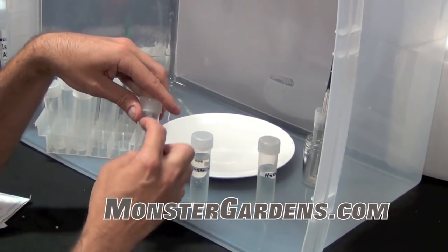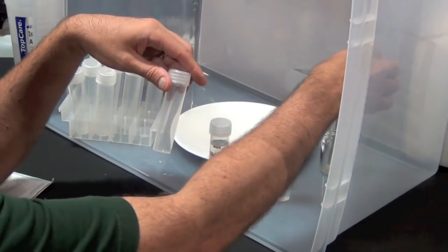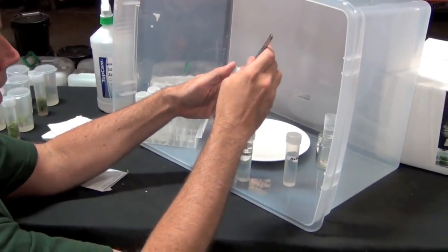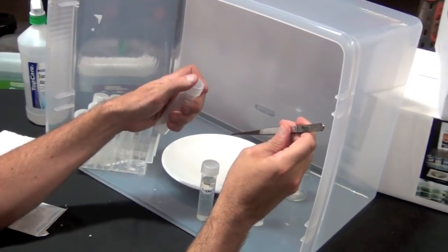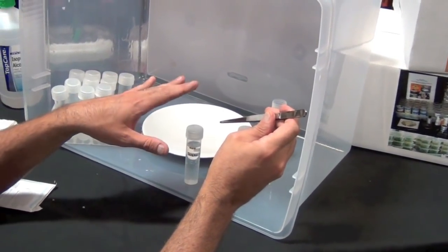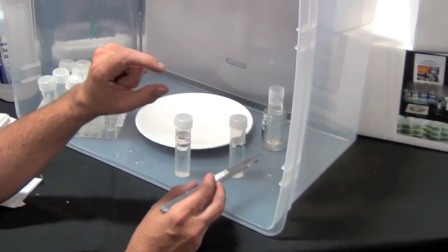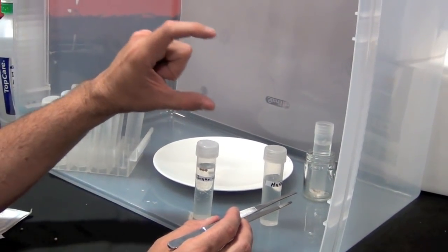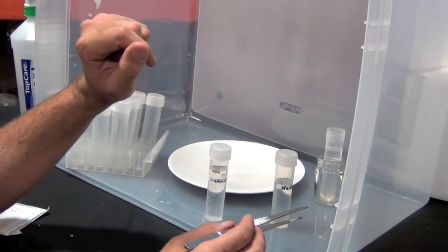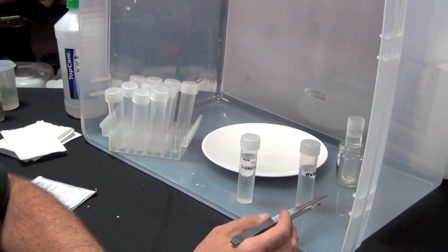We can extract the entire thing — roots, tops, and everything — and plant this into whatever we want: root plugs, small pots. We will have taken an old seed that may not have germinated and very likely would have become contaminated, and been able to grow it into a two-inch seedling that we can now plant into an ordinary pot of soil. When we're doing this with healthy, valuable seeds — some special tomatoes and vegetables where single seeds may be fifteen or twenty dollars — do you really want to risk just putting them in paper towels? Using these materials and this exact same technique, we've been able to soak, hydrate, and germinate healthy seedlings that grow tall in as little as twenty-four hours. Two or three days is still impressive. We're putting in mobile sugar and oxygen, which is exactly what the plant is supposed to be doing on its own — we're just doing it a couple stages up the line. Those are the basic pieces of the MicroClone seed starting kit, and this is MonsterGardens.com.